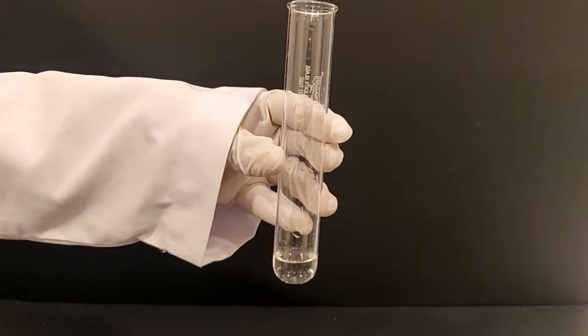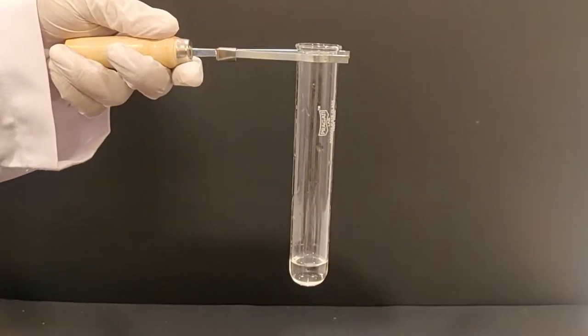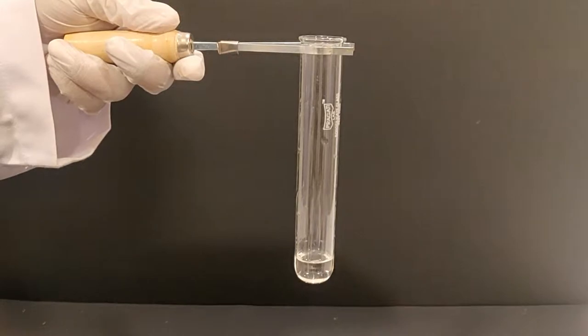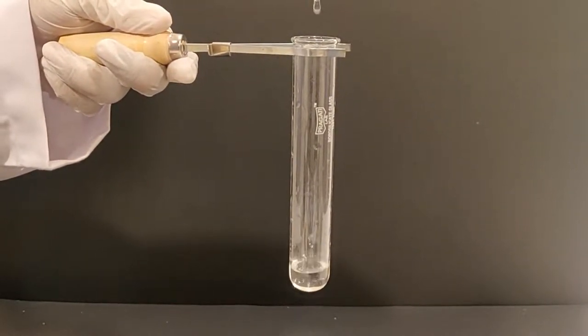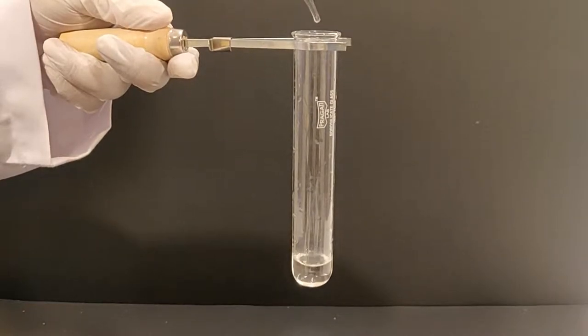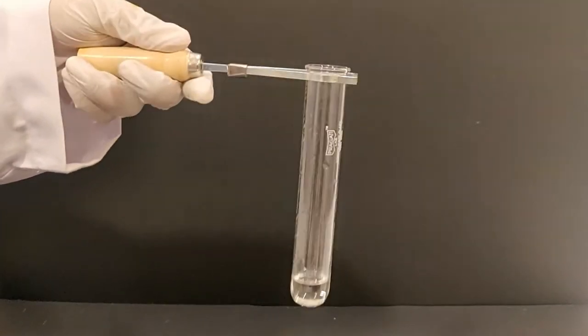Do you notice any color change? Now, using a dropper, add a few drops of the sodium hydroxide aqueous solution and gently swirl the test tube to ensure the contents are well mixed.